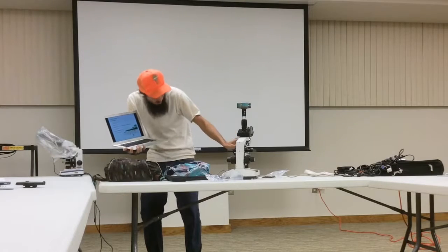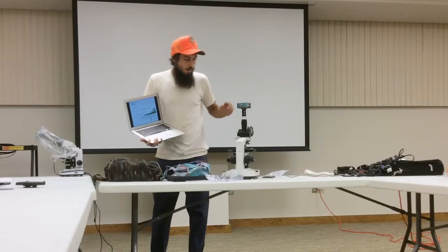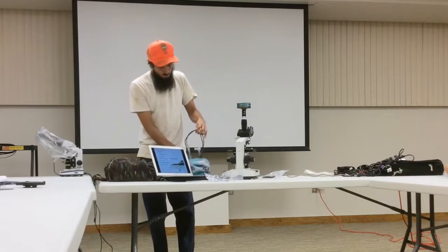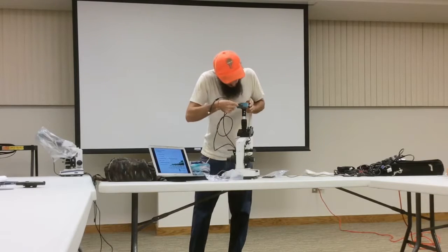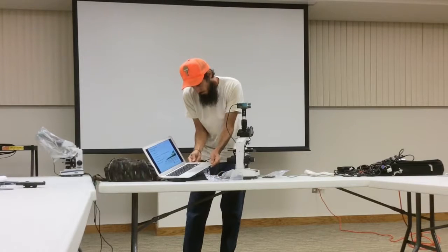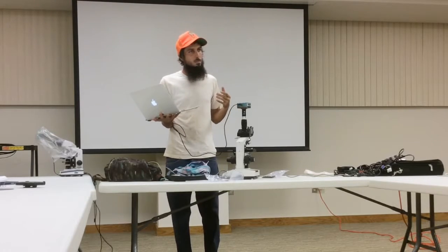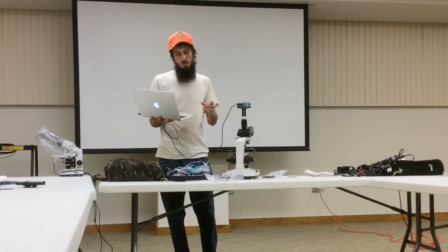So what I do is I put the microscope to 100 times power, and then I just scroll across the slide. Nematodes, you're looking, once you find the nematode, you can identify what it is. But for every slide, I should have one nematode.